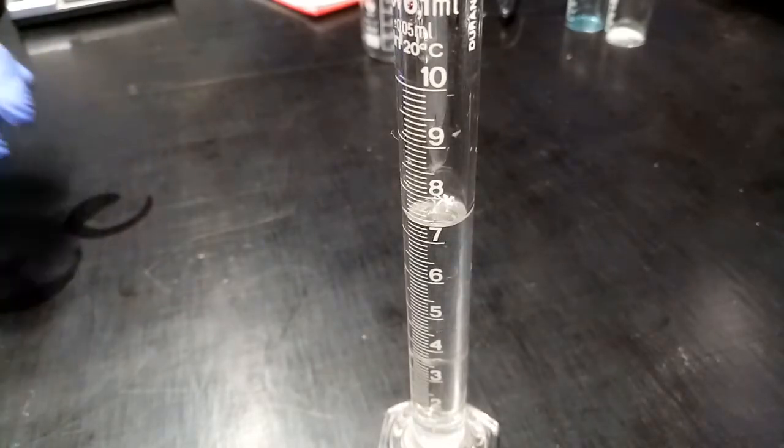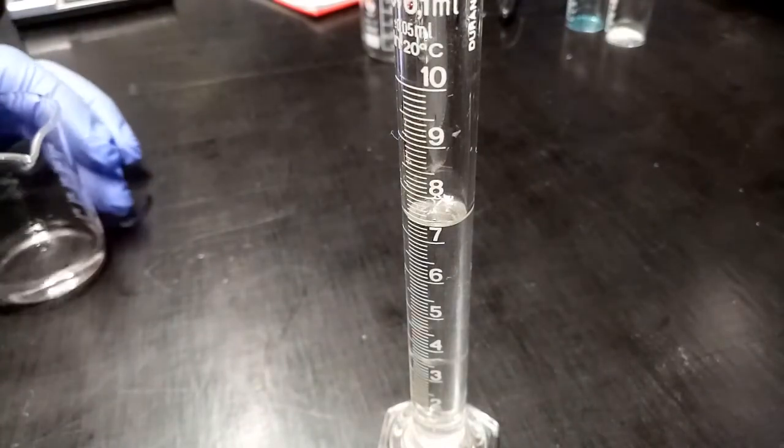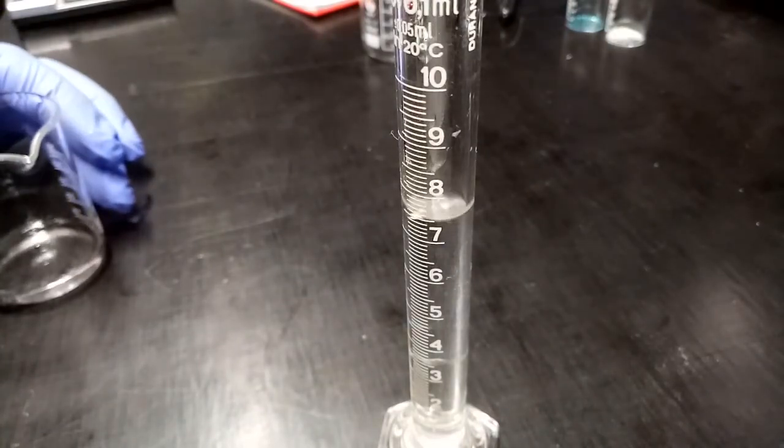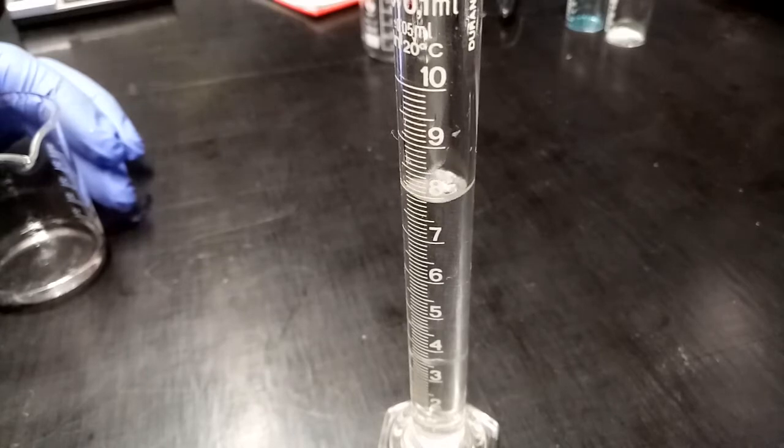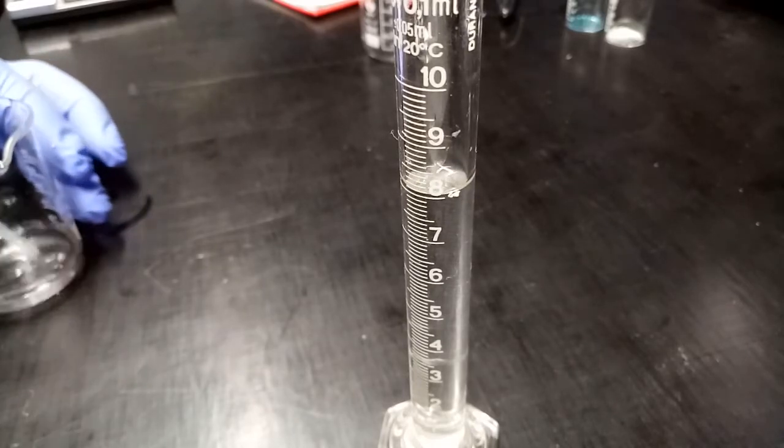The reaction medium is methanol and water, and here's me very carefully measuring up methanol. I needn't have bothered - a whole bunch of methanol, unmeasured, was getting added later on.